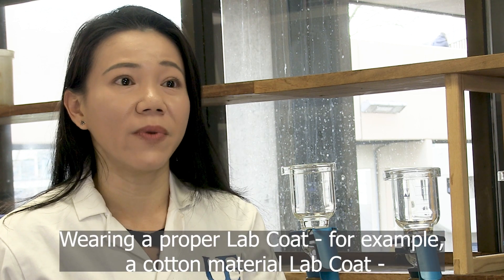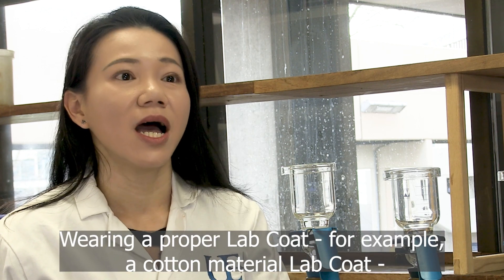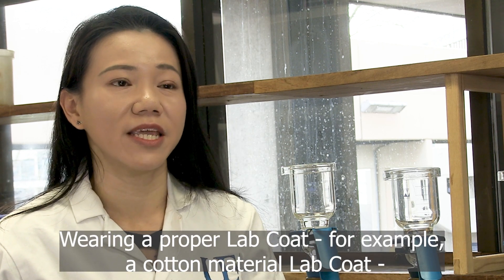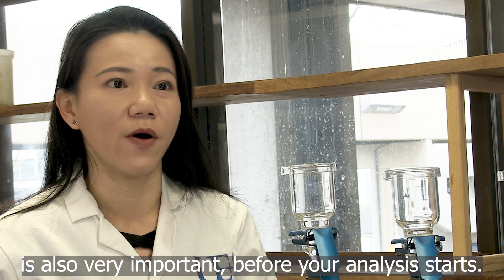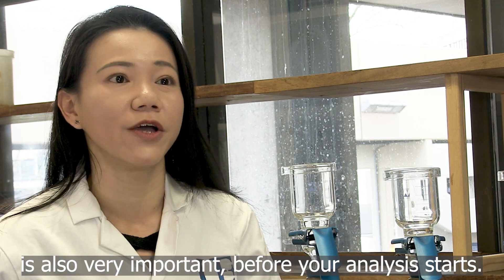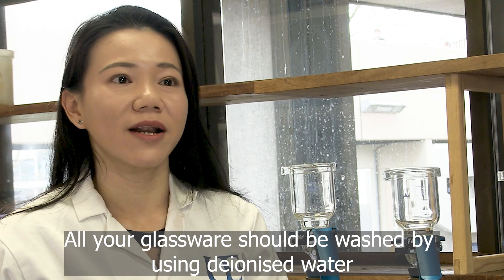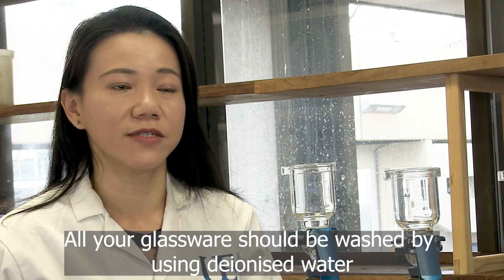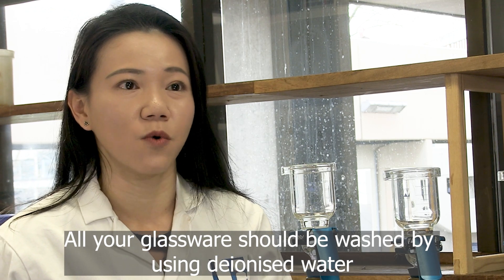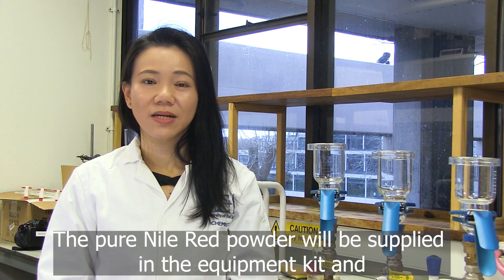Wearing a proper lab coat — for example, a cotton material lab coat — is also very important before your analysis starts. All your glassware should be washed using deionised water or Milli-Q water before use.